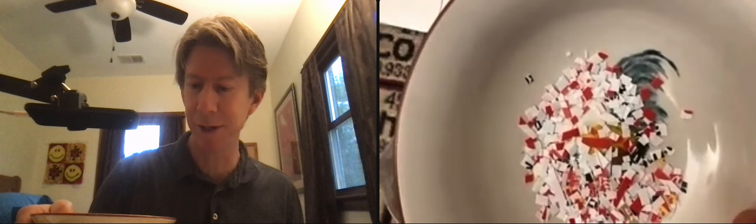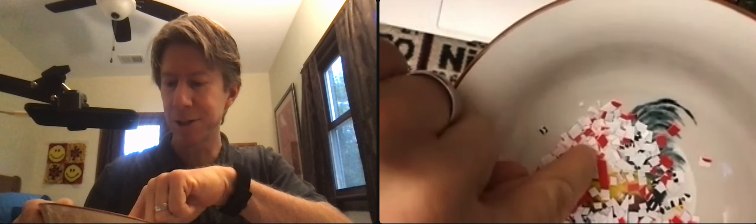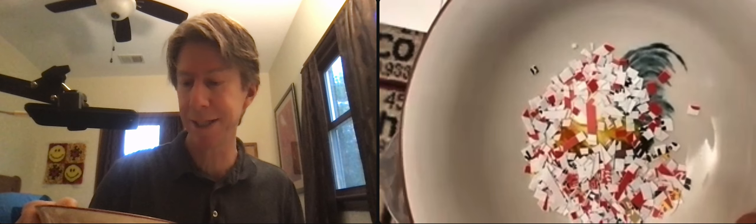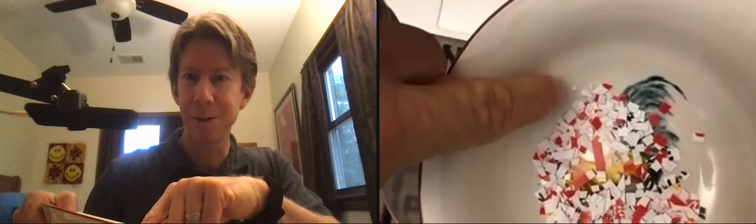You can see when you get towards the end some of the pieces are a little bigger but most of them are pretty tiny. There's a real tiny one right there.